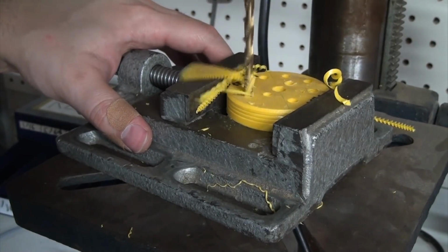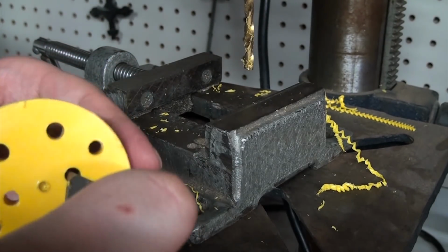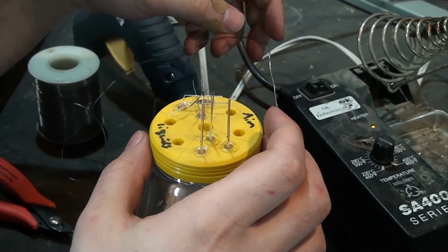With the part shaped, I could drill a bunch of holes for the air input and exhaust, nutrient feed and waste removal lines, and then half a dozen holes for UV LEDs. I figured these could be fun if I grow fluorescent proteins in here and could help with sterilization if I just left them on for a while while the system is empty.